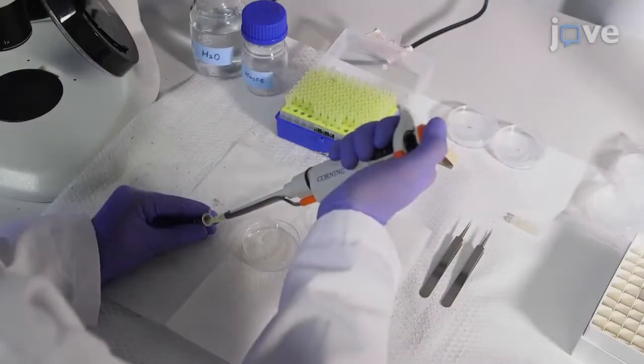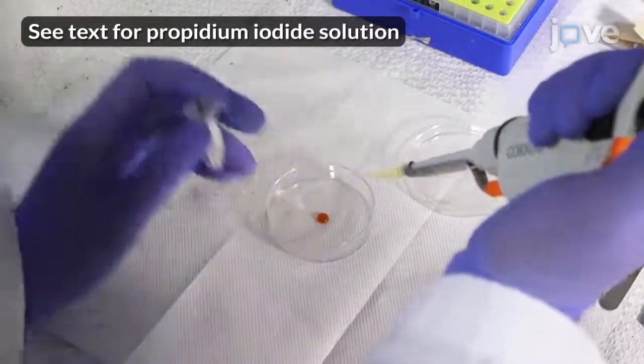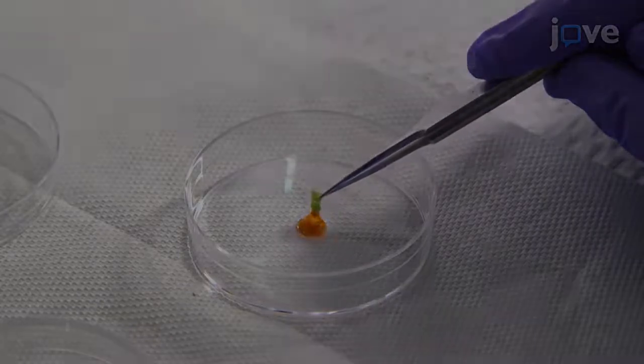Pipette 50 microliters of propidium iodide solution in a clean and empty Petri dish. Dip the whole dissected shoot apex into dye for 2 minutes.